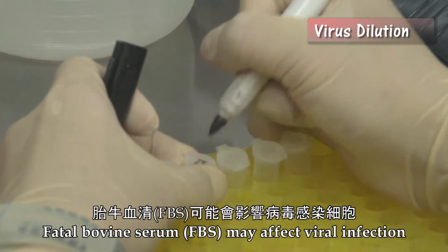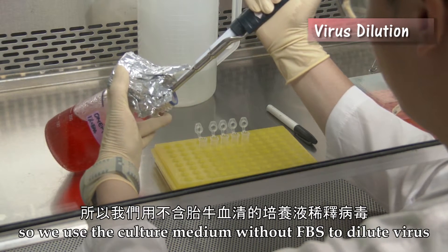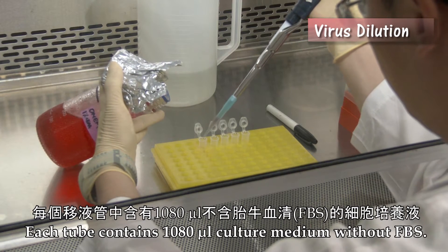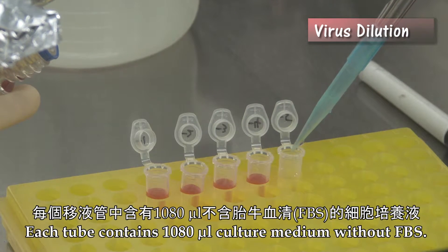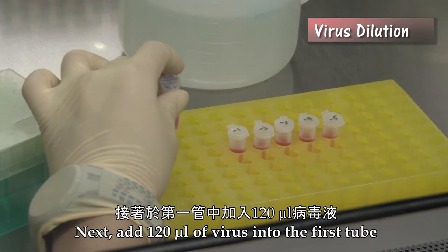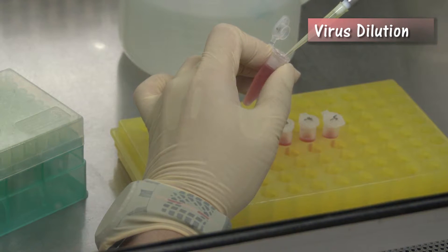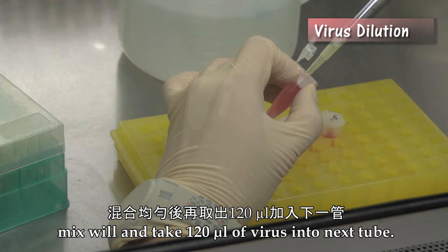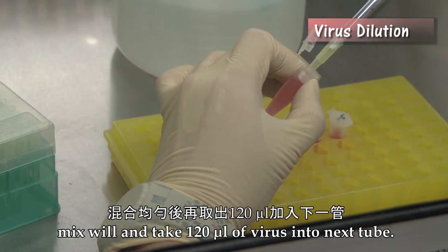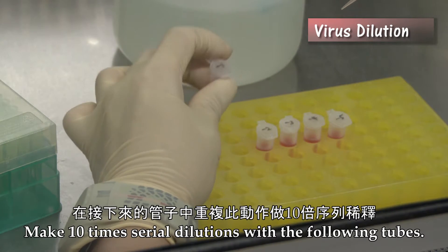Fetal bovine serum (FBS) may affect viral infection, so we use culture medium without FBS to dilute virus. Each tube contains 1080 microliters of culture medium without FBS. Next, add 120 microliters of virus into the first tube. Mix well and transfer 120 microliters of virus into the next tube. Make 10-fold serial dilutions with the following tubes.